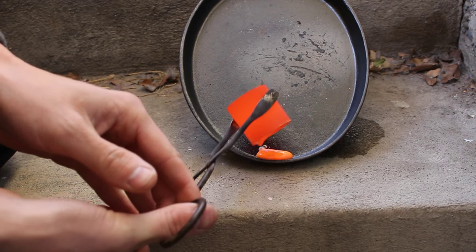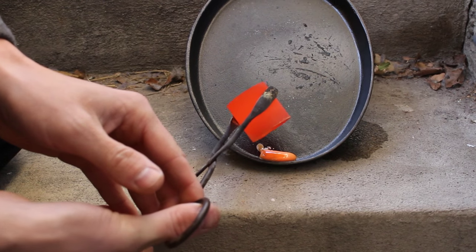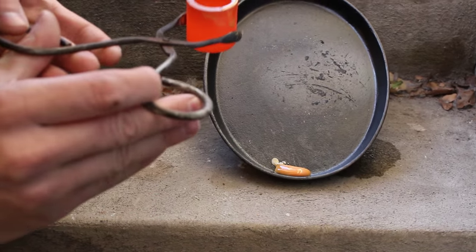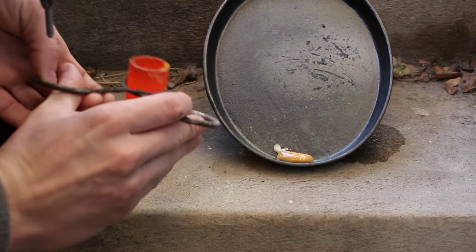Do you see any metal? Oh, I see metal right there on the edge. See that? Right there.